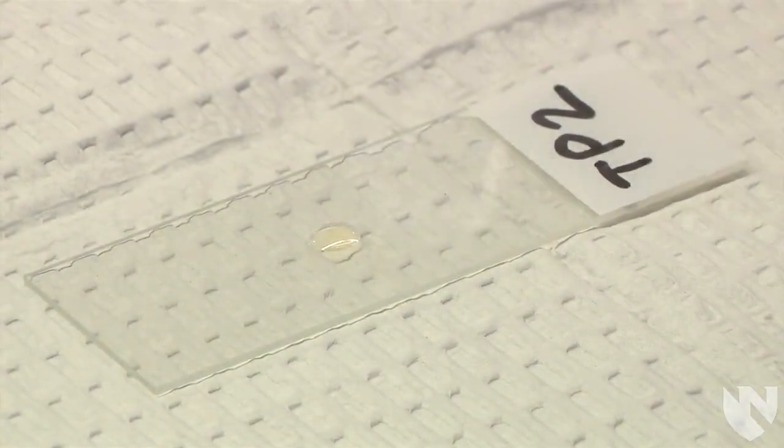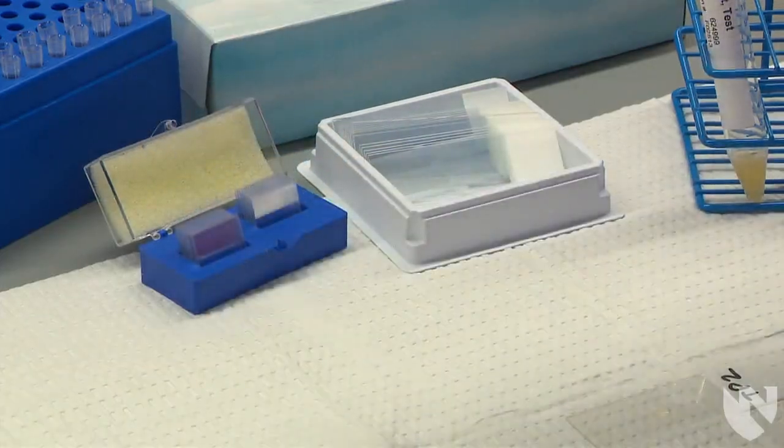Dispense the sample onto the glass slide. Place the cover slip over the specimen.